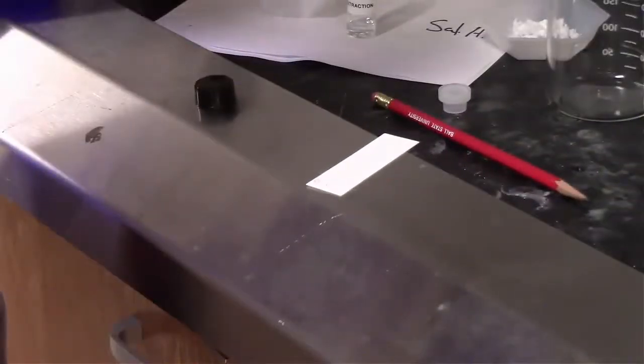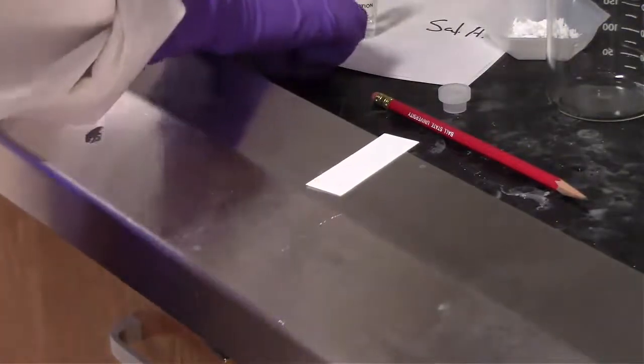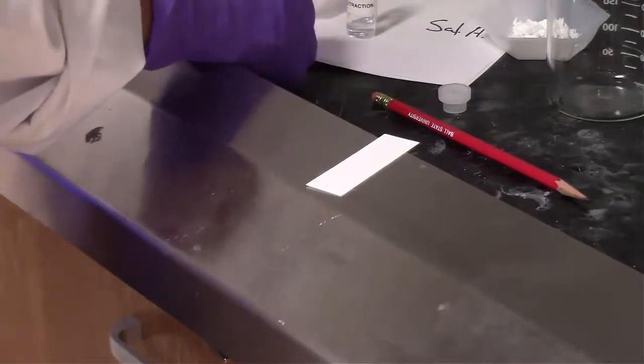So I would probably just not hold it down on the plate that long. You can always hold it down, let it dry, and then spot again. That was a pretty good spot, so even a smaller one would be okay. Again, if you spot it, lift it up, let it dry, spot it, lift it up, let it dry, you can essentially get double the amount of compound there with a much smaller area, which makes it easier to read what your spots will look like under the UV light before you run the plate and after you run the plate, if you make your spots very small and definitive.